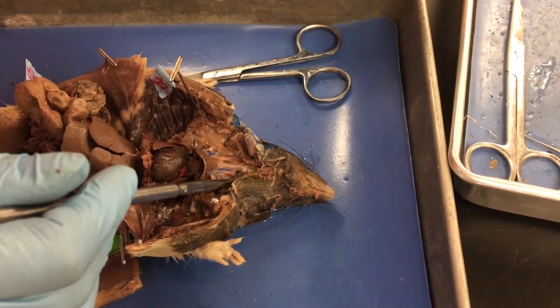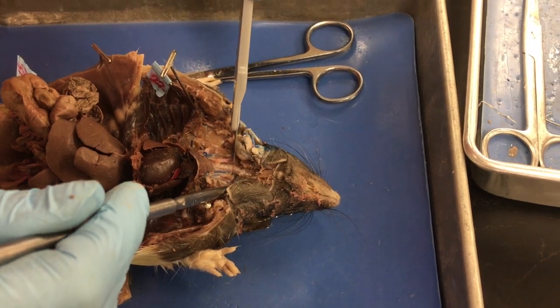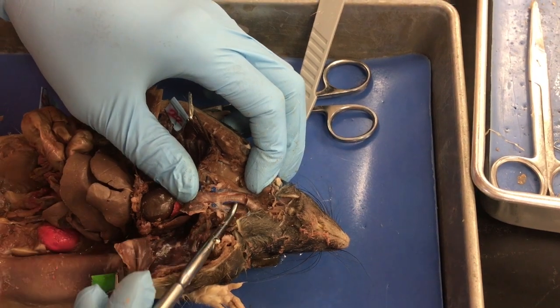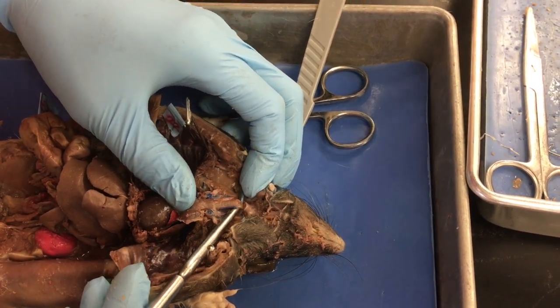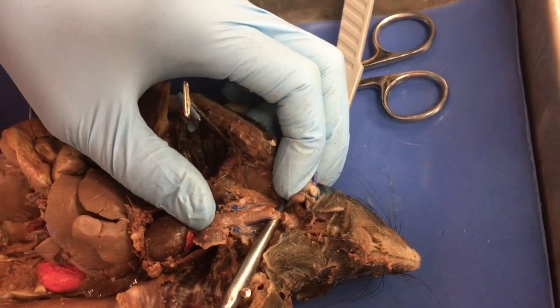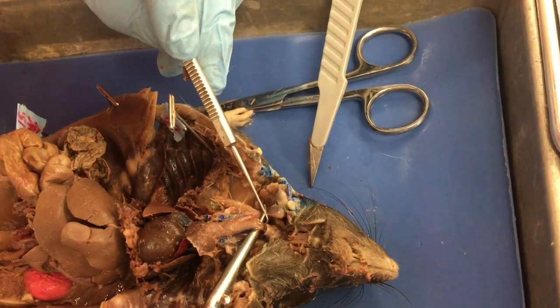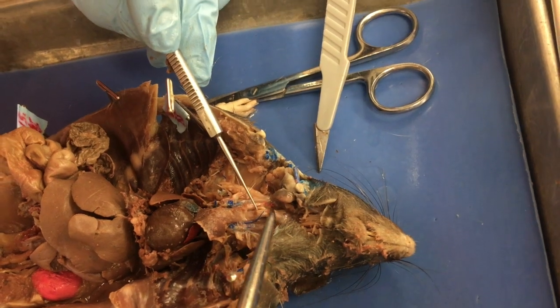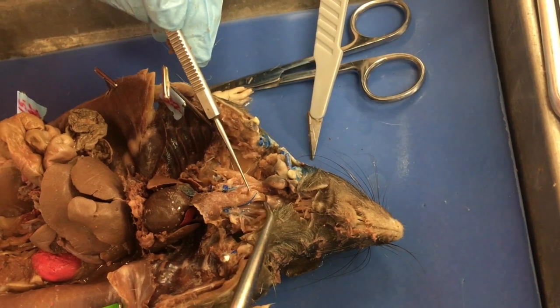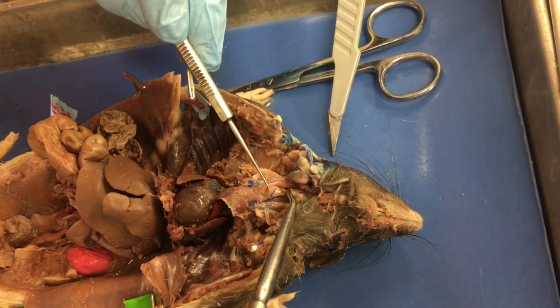If I do the trachea, let's go ahead and just cut open his trachea. So when I cut the trachea, do you see where there's like a second hole? I don't know if you can see that, Melissa. I can't. Okay, just use your imagination, people. So there's a second hole back there, and this one's my trachea hole, and then this hole down here on the bottom, that's my esophagus hole. So if I have a pin coming out of that second hole back there, then you know, okay, this is a trachea, that's got to be the esophagus hole.